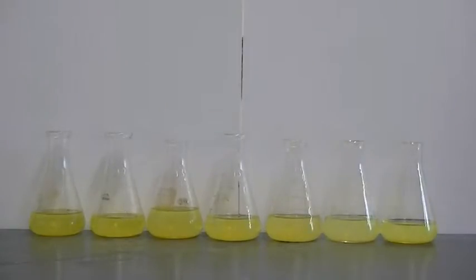Let's explore the acid base indicator properties of curcumin a little bit further. In each of these flasks, I've dissolved a little bit of the sunflower dye into some acetone. Into the first flask, I'm going to pour some buffer at pH 4.